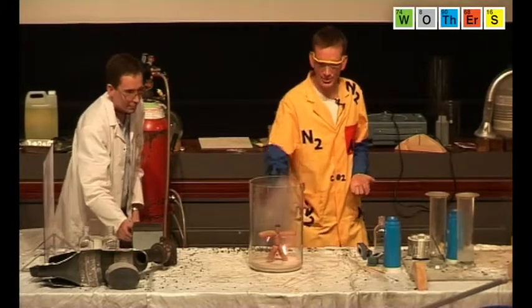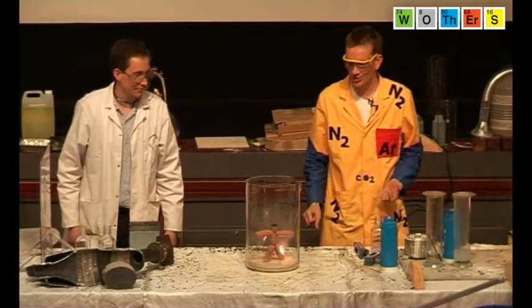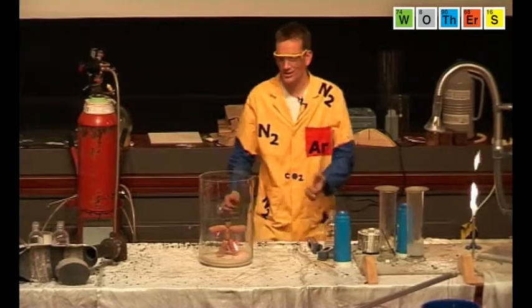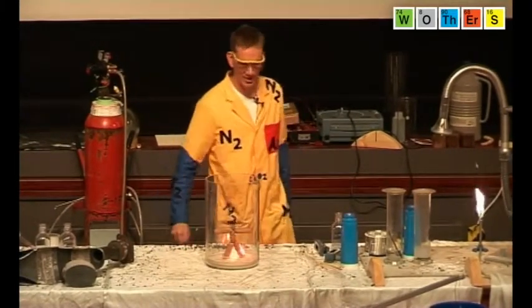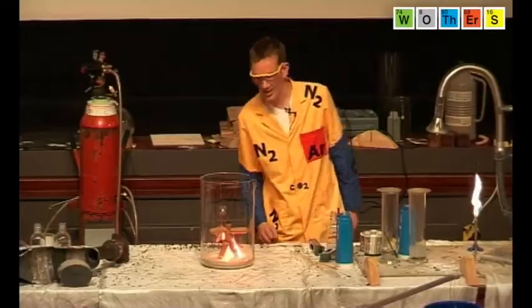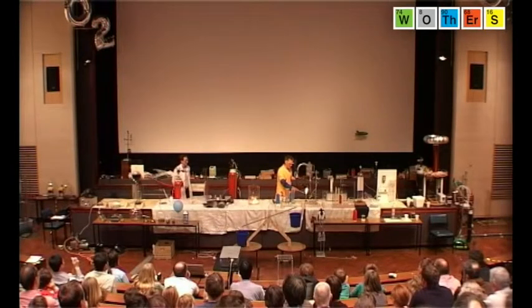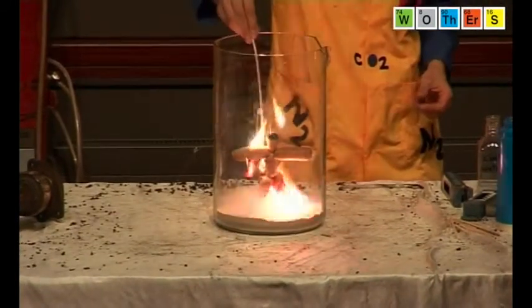We just added a hot wire here, and his leg seems to have caught fire. Okay, and he seems to be burning. Well, this is like spontaneous human combustion. Just accidentally leant on a bit of a fire, and he's gone up. And he seems to be going up rather vigorously. I don't know if any more is going to catch fire. Maybe we can help a bit more if I add a bit more light. I don't know if this is a bit cruel, but see if we can get this arm to go up as well.